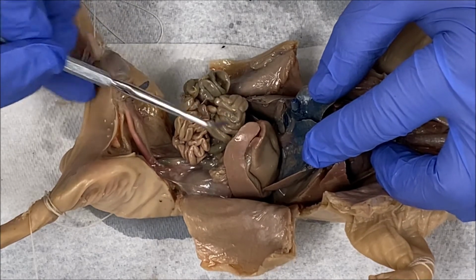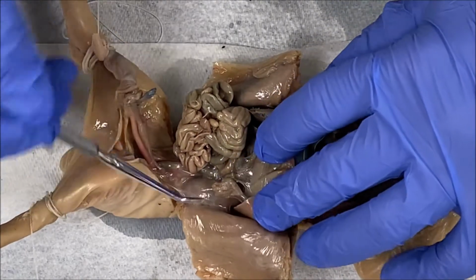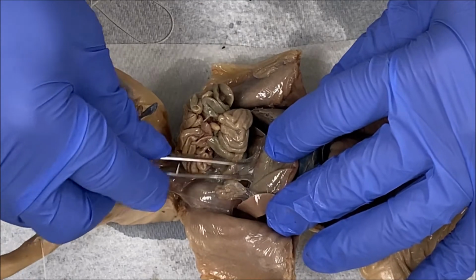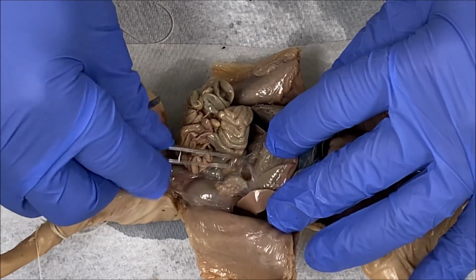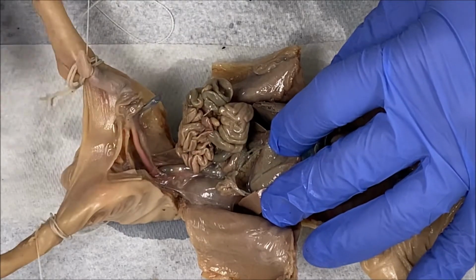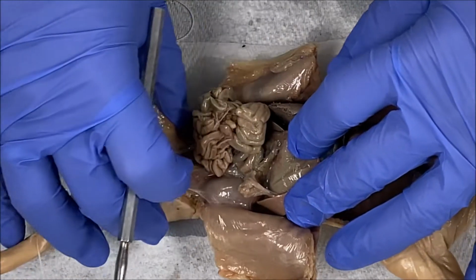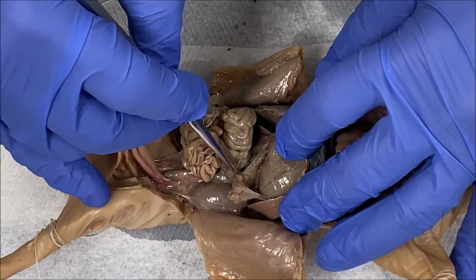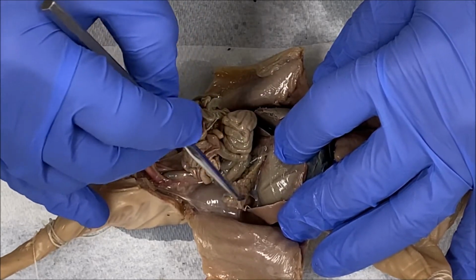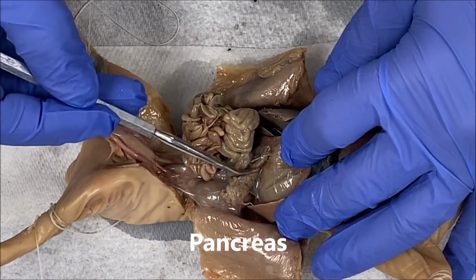The next accessory organ is going to be located, right, underneath the stomach. And this might be very hard to see. You see that there's some connective tissue, so I'm just gonna take my forceps and kind of just move some connective tissue around, right? But underneath the stomach, you have another accessory organ, right? Right here. This is called the pancreas, okay? So here's the pancreas.